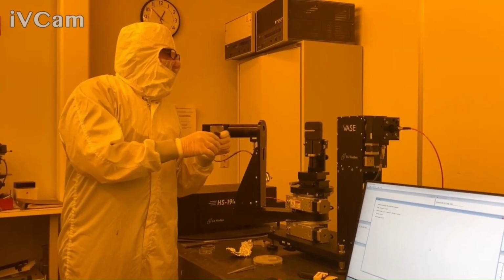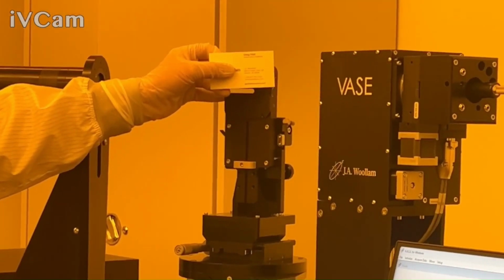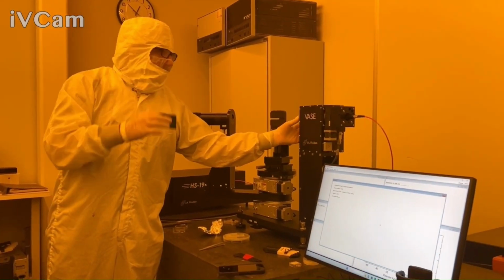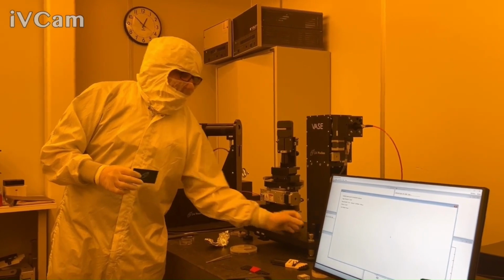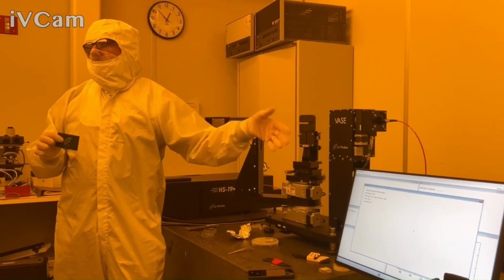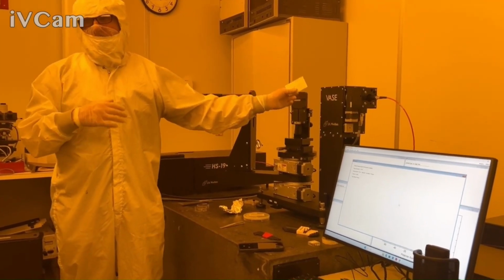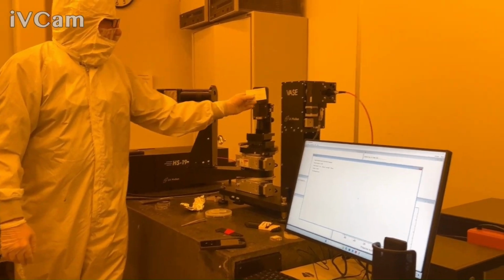So, we would split the beam off and track fluctuations in the lamp, and we would make sure our beam was always reflected, not bigger than the aperture, stuff like that. So that's at least what you can show there. I mean, you can move it to other colors as well, move it to green, whatever. And that's always fun to show. Right, like, look, green light, red light. You can move the monochromator to different wavelengths. I just wanted to show that.